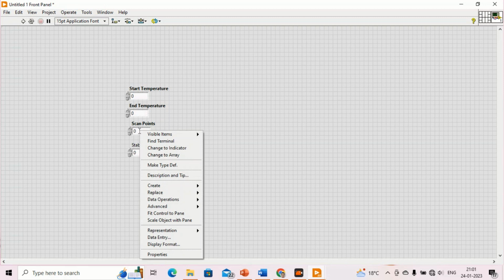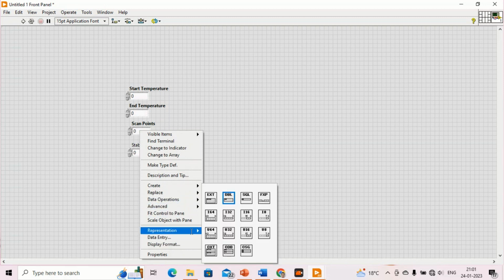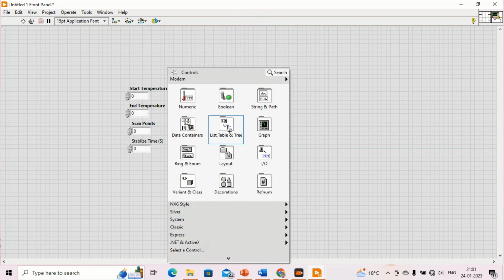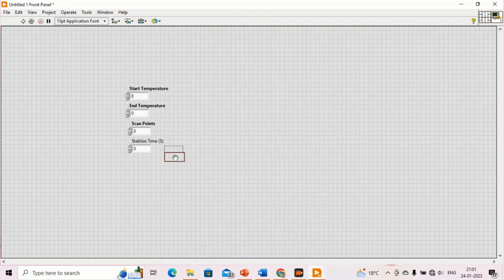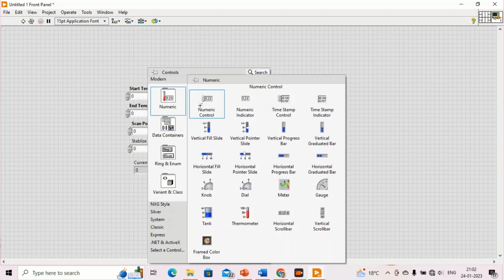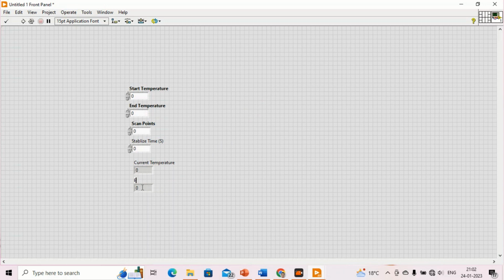Scan points can only be integers, so we will set it for integers, and we want some numeric indicators. This one for current temperature, and again error in temperature. So this is kind of the user interface.